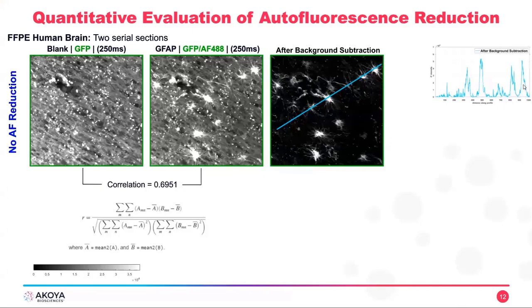As we can see here, this high peak corresponds to this astrocyte. There's another high peak here, this second astrocyte. These are the branches that we are seeing here. This astrocyte is this high peak in the middle. And using the signal, we can set up a threshold to define our real signal versus the noise and calculate the signal to noise ratio using the mean intensity of the signal to the mean of the background noise.